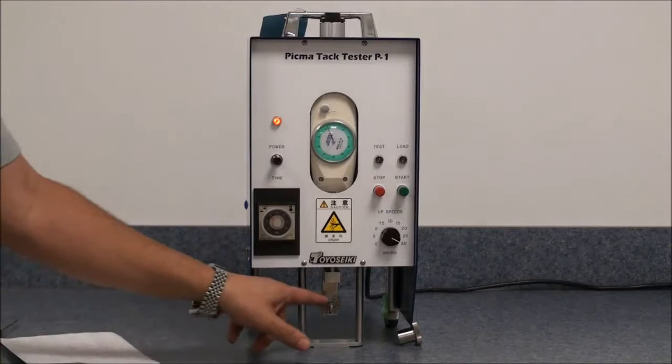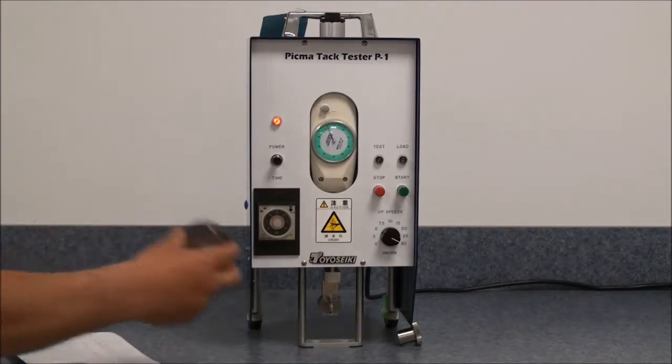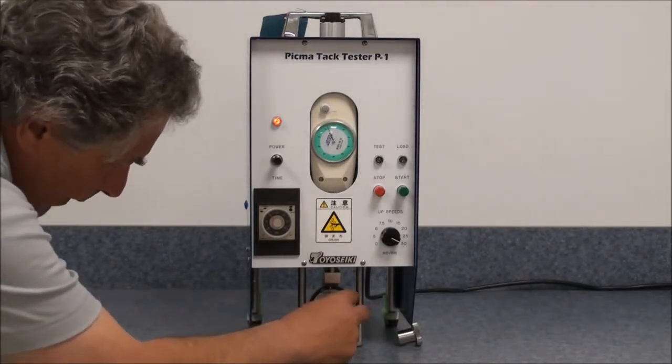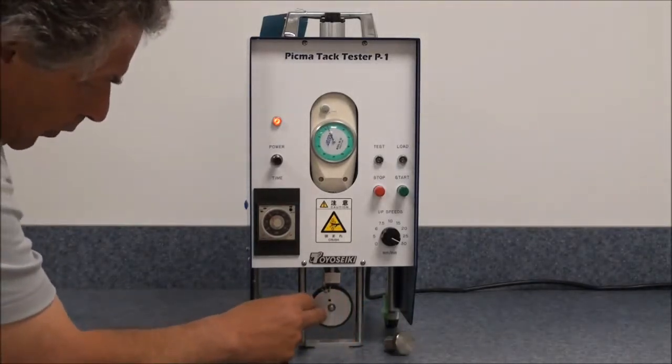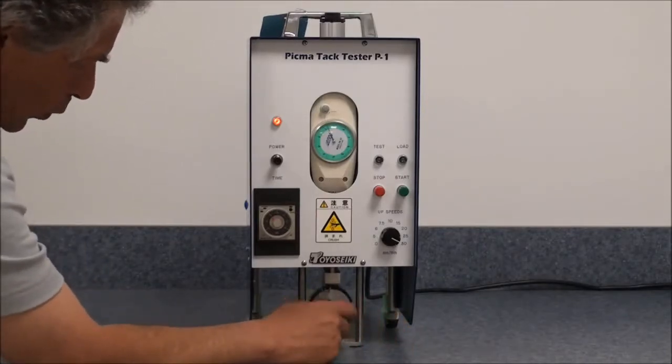The sample is then placed on the attachment at the bottom. Make sure it goes all the way down and then tighten it up with the screw.